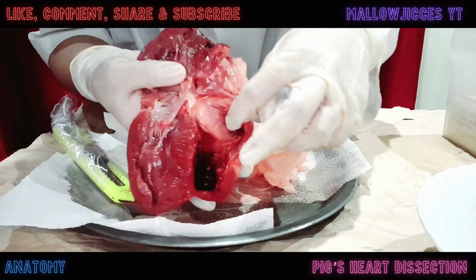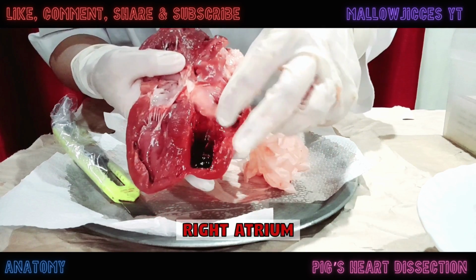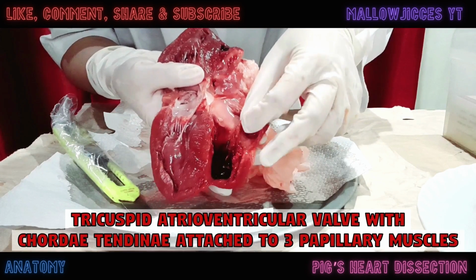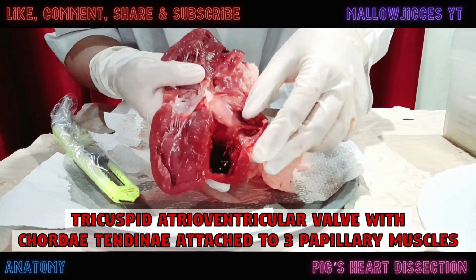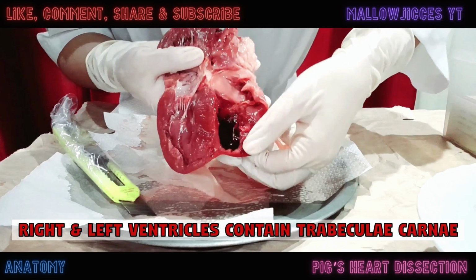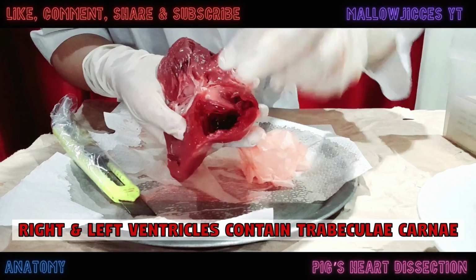Beginning from the vena cava, the blood enters into the right atrium. We then have the tricuspid valve, which has its chordae tendineae attached to 3 papillary muscles within the right ventricle. The right ventricle, as well as the left, contains some grooves called the trabeculae carneae.